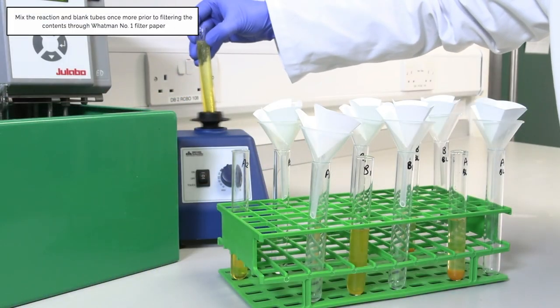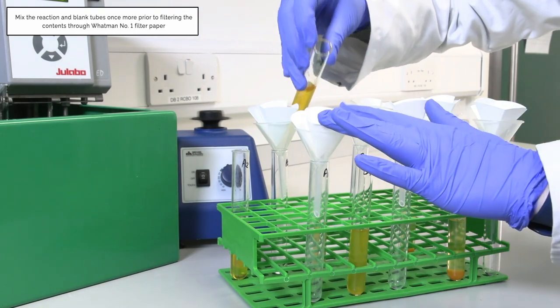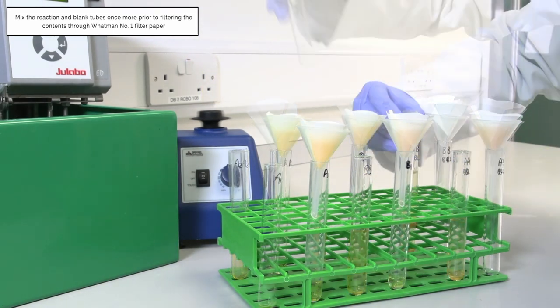Mix the tube contents of the reaction and blank tubes once more prior to filtering the contents through Whatman number 1 filter paper.